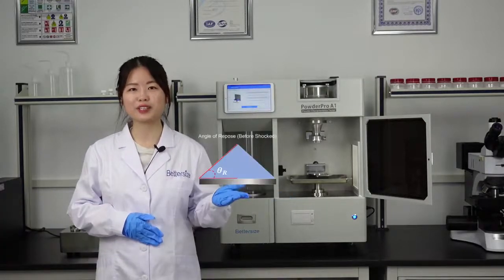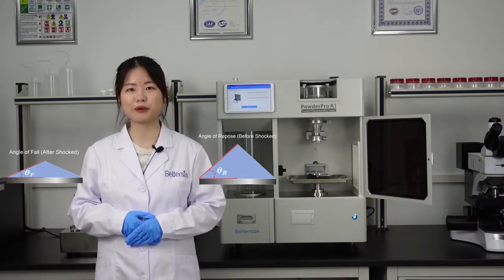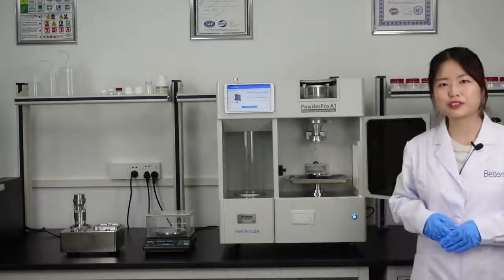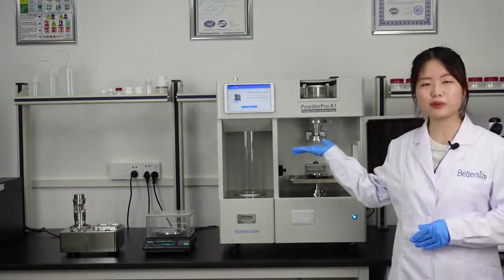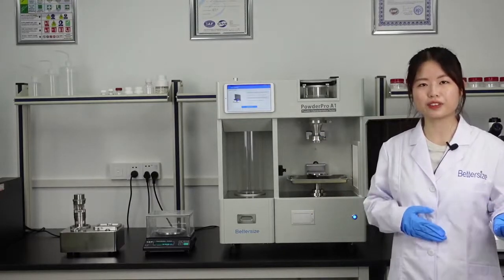Hello everyone, I'm Shelley. Welcome to the BetterSize Lab. The angle of repose and angle of fall are important factors determining powder's flowability. In this video, I will demonstrate how to use the PowderPro A1 to measure the angle of repose and angle of fall, and calculate the angle of difference.